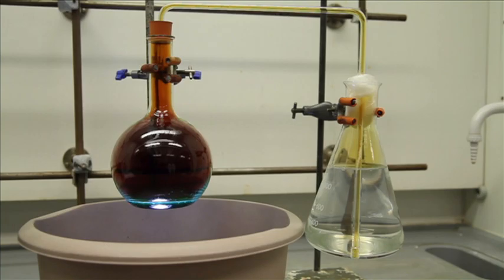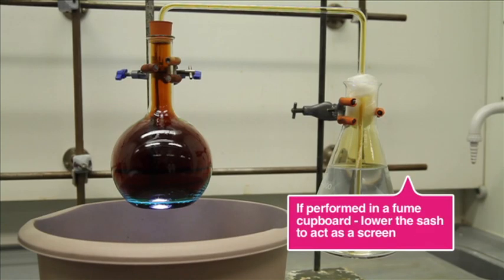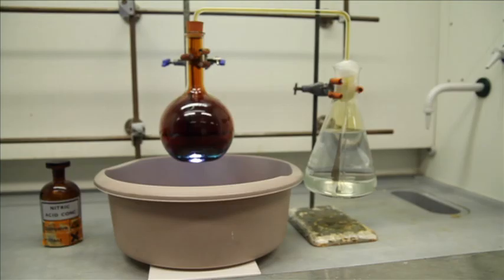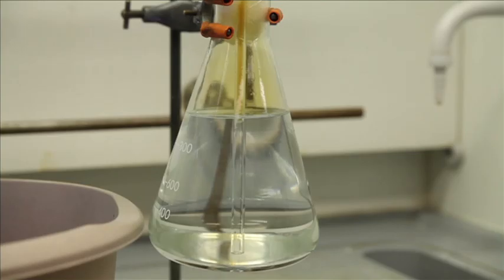This is where additional steps have been taken to minimize risk. There's a small chance that the reaction flask could be damaged by the rapidly changing temperatures which follow the addition of the water. As such, if this experiment is performed in the open lab, both students and the demonstrator should be protected by safety screens. A trough or bowl is placed underneath to contain the mixture in case of any leaks. I've placed a small LED light in mine to help the camera pick up the colours.